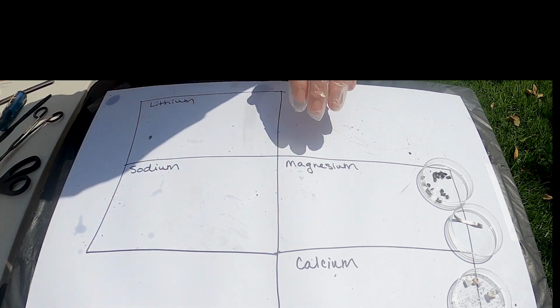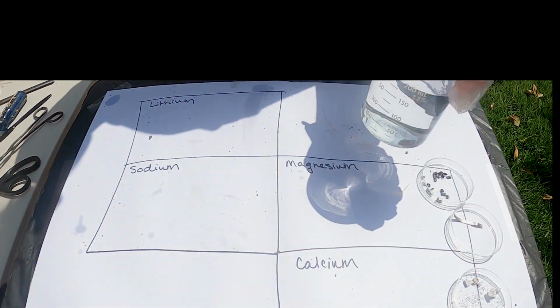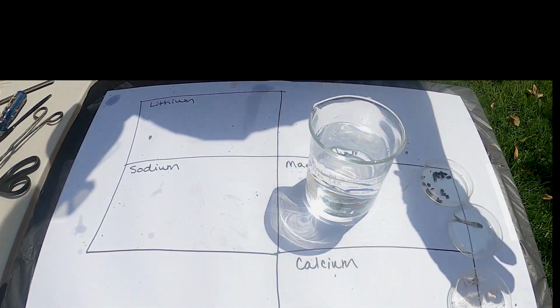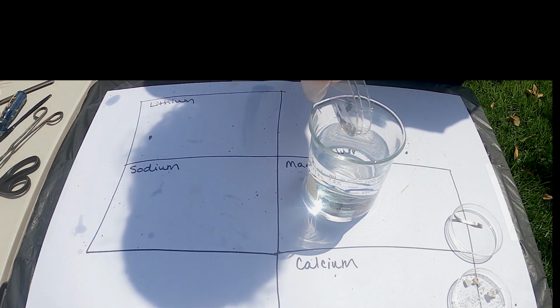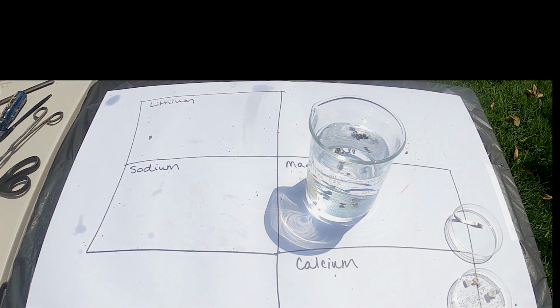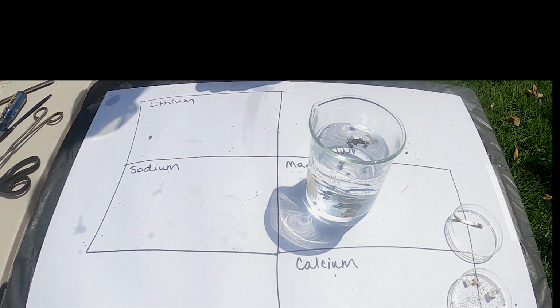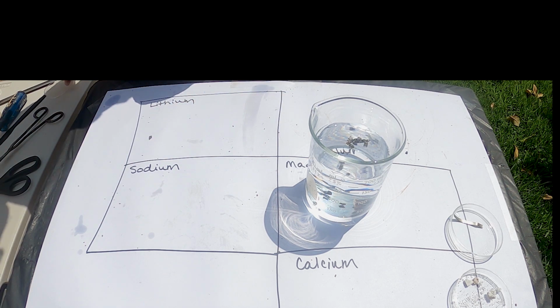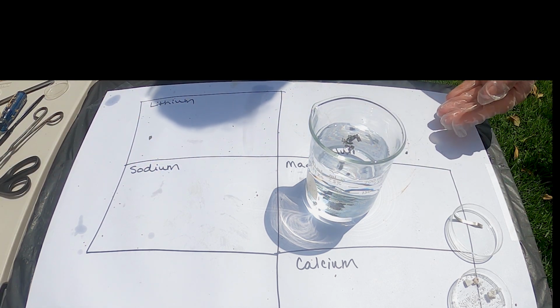All right, let's look at magnesium next. We're going to use the turnings, just to give it a little more surface area to react. And so exciting! I don't see any signs of a chemical reaction. That's weird. But I do notice some of them float and some of them sink. That goes to the physical properties.